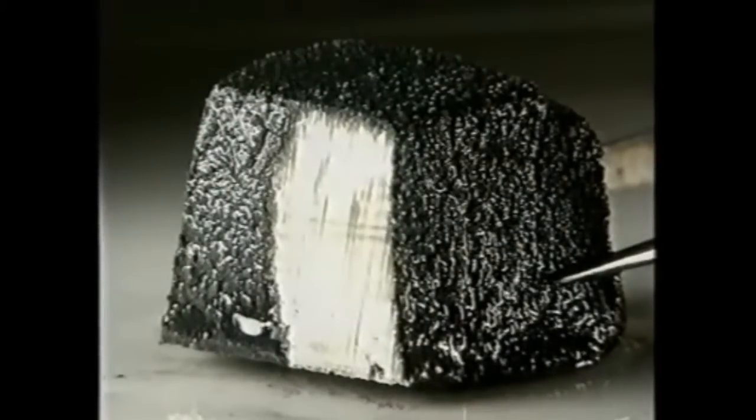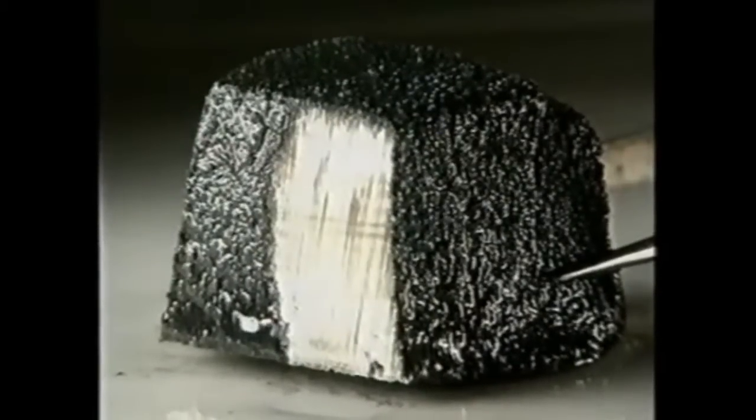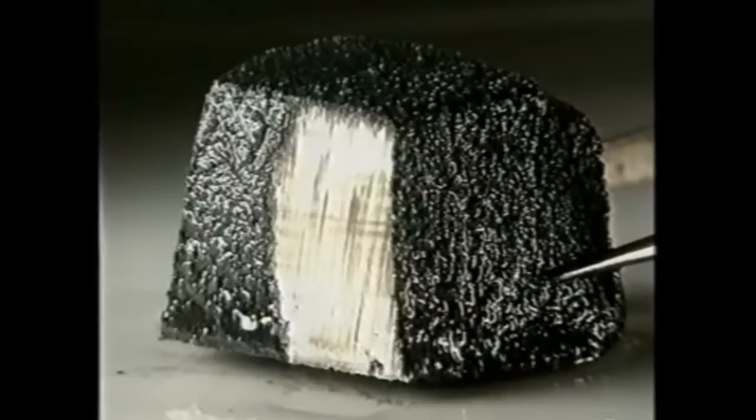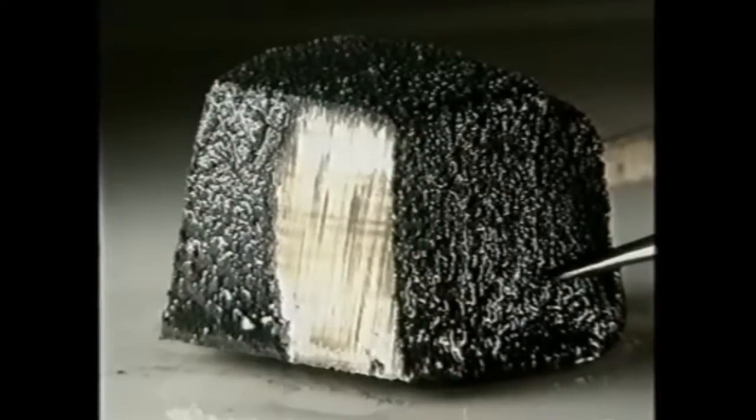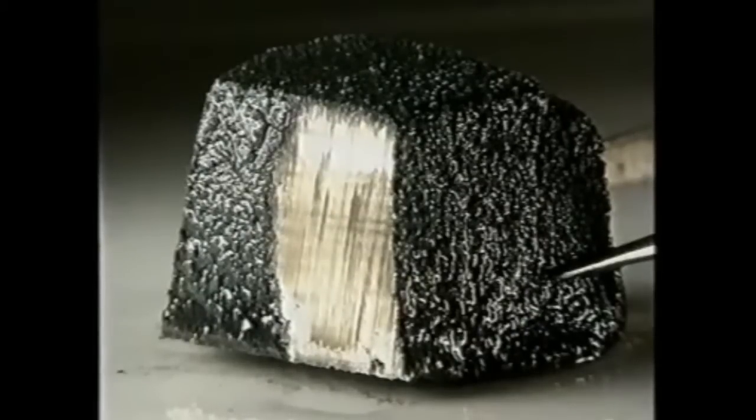You can see how shiny the freshly cut surface is, but leave it exposed to the air for a few seconds and it quickly begins to tarnish. It's reacting with the air.